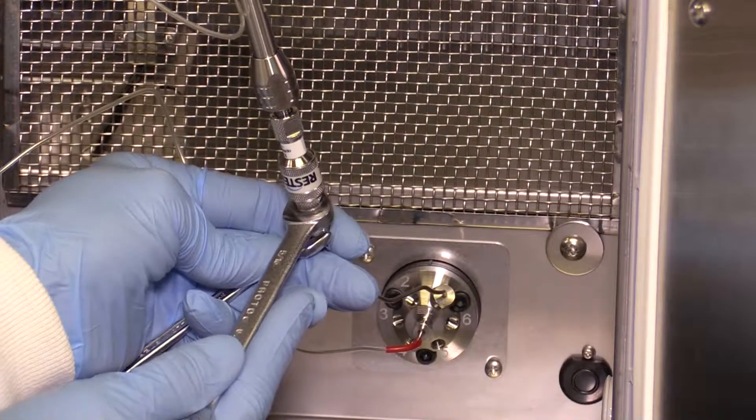When making the shift to UHPLC, the EXP fittings can be used at pressures greater than a thousand bar using a wrench and an extra quarter to half turn.